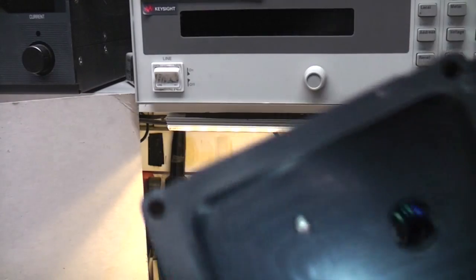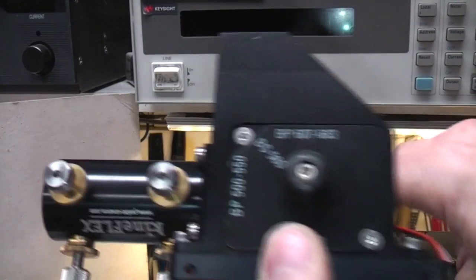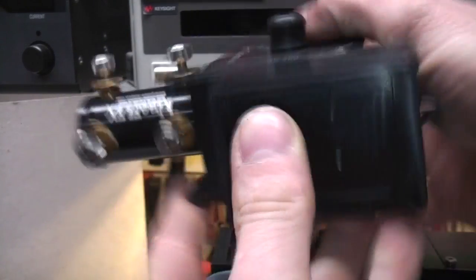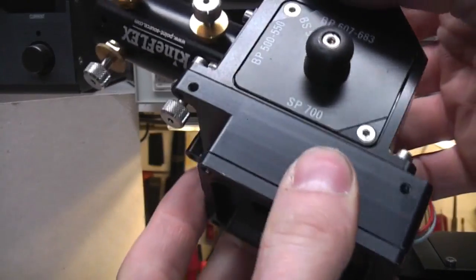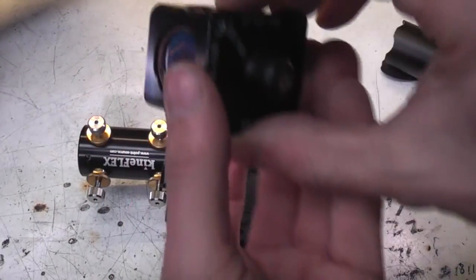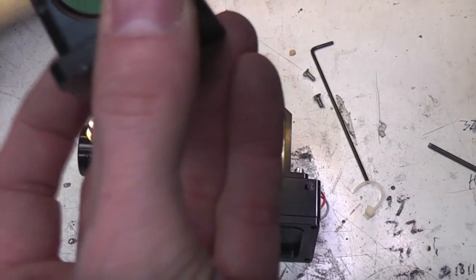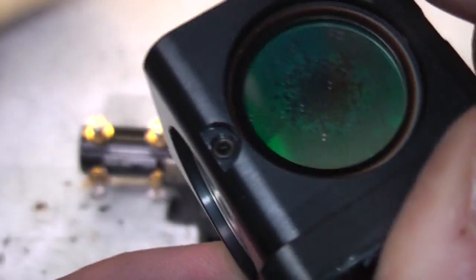Doesn't seem to want to gravity close, but again I think this had actually been bashed off because the threads did seem to be quite chewed, and this was just separate floating around in the unit, so I think this was just on its side, it's probably just got knocked, or the whole thing rested on it. And this is clearly a removable section, so depending on which lasers you replace this, and this has actually got the filters in there. Interesting, that one looks like it's had some damage over time.